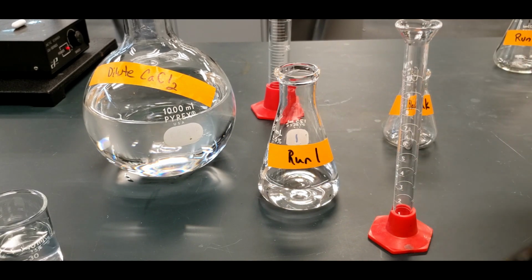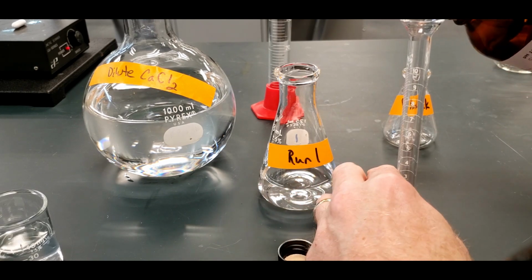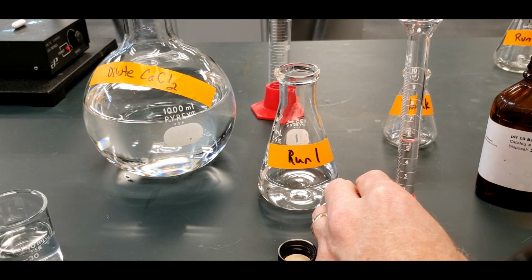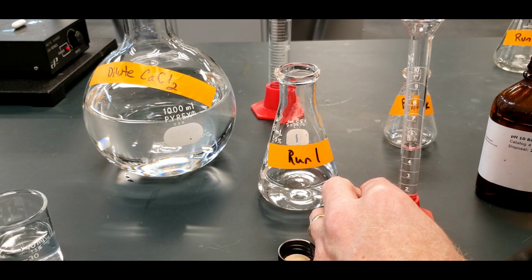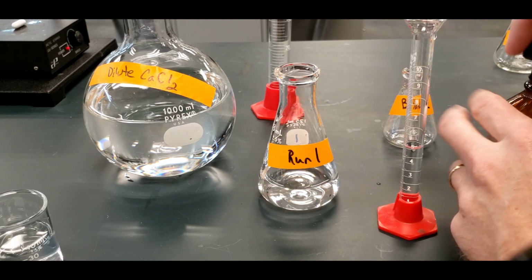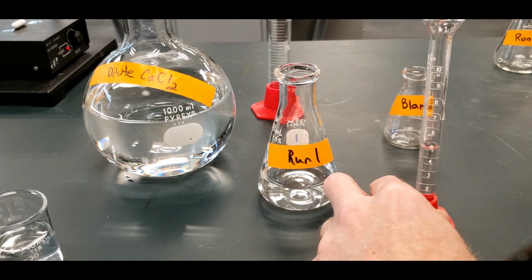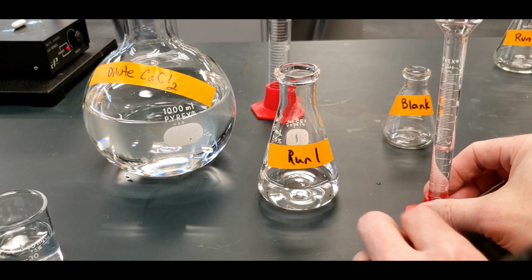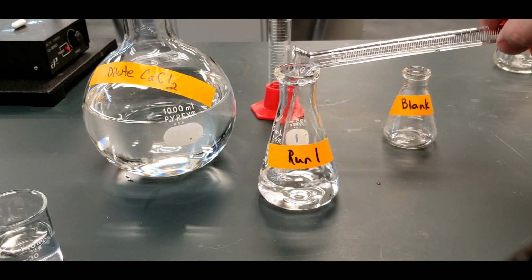This buffer. Ooh, way over. Yeah, we'll just bring this down. This goes in the waste. Never put it back in the reagent bottle. Anything you take out, even though we're pretty clear that it came from here, you never know. And you don't know what was in the graduated cylinder either, so we don't want to contaminate our bottle. So anything that you don't use gets put into the waste. So this is 5 mils of the buffer.